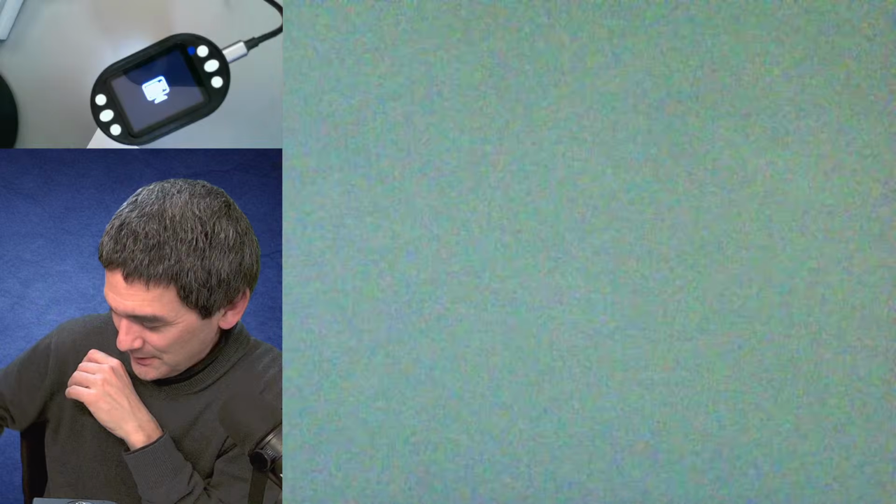What about the needle? Maybe you can clarify for me. It's the second time that I'm actually using this device, just for your information. Yeah. So let's have a look. Let's have a look at this under the microscope here. And where is it?